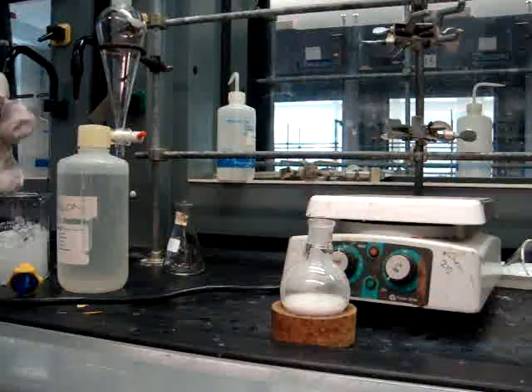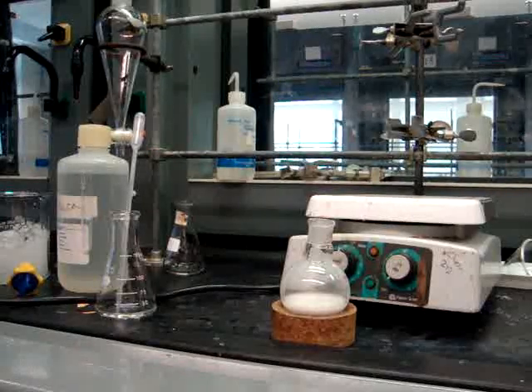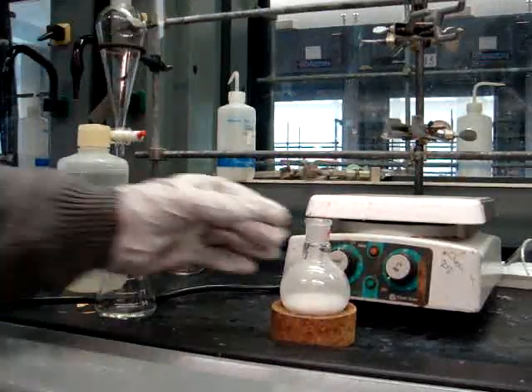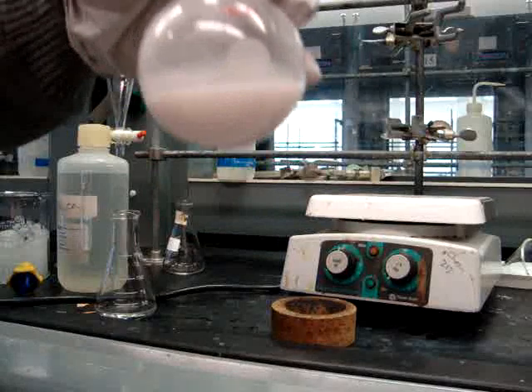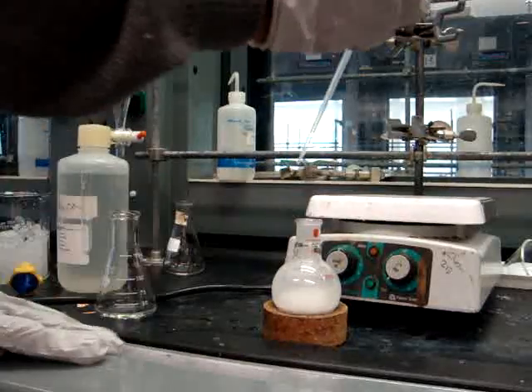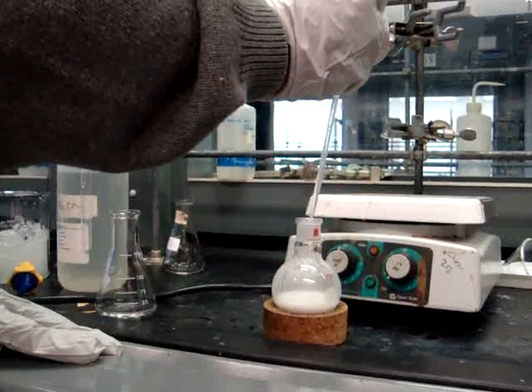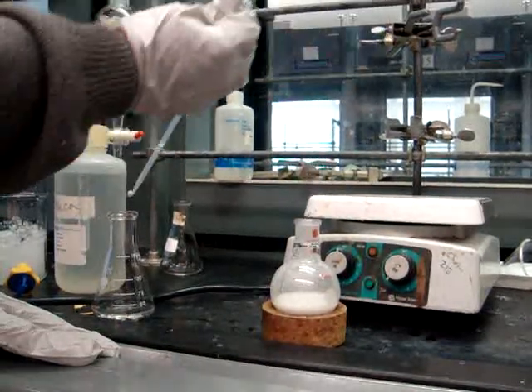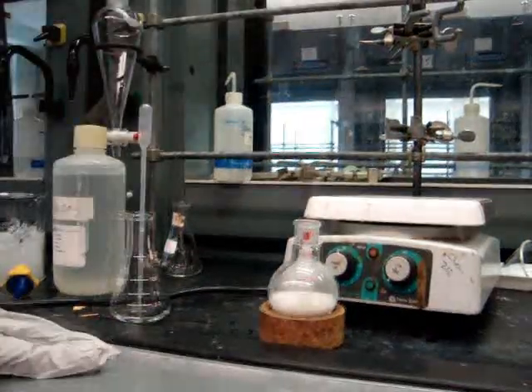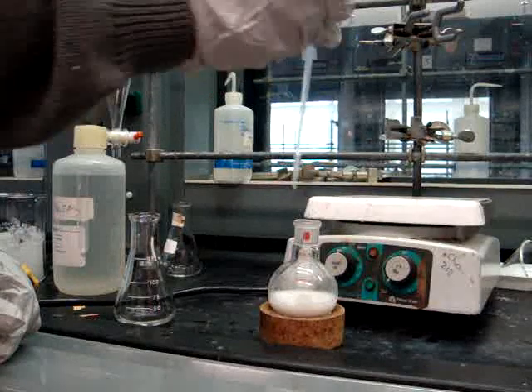After you're finished refluxing for the hour, you'll remove your round bottom flask from the heating mantle and let it cool to room temperature. Then you will neutralize the solution by adding 10% sodium bicarbonate to the mixture dropwise. You want to do this very carefully. There will be gas evolution from this process, so remember to be quite cautious when adding the sodium bicarbonate.